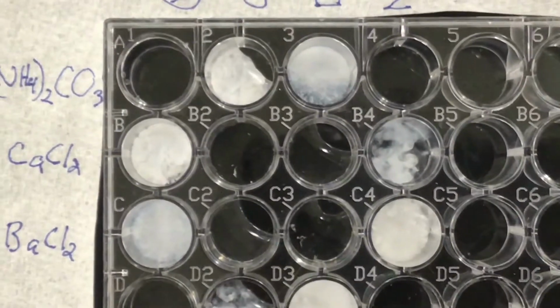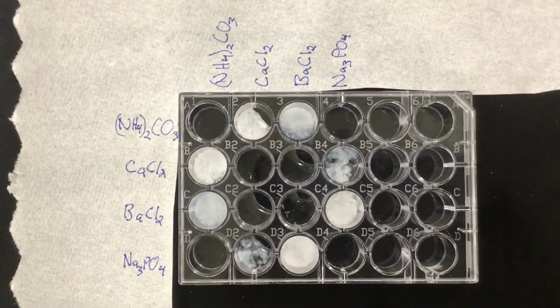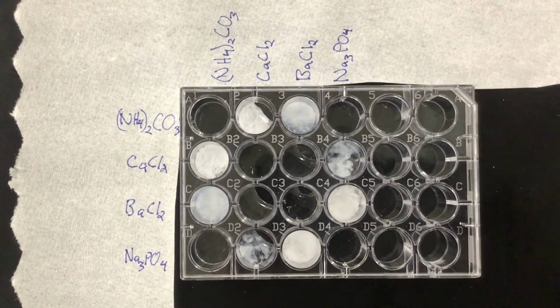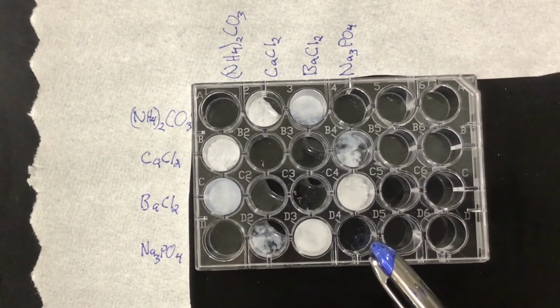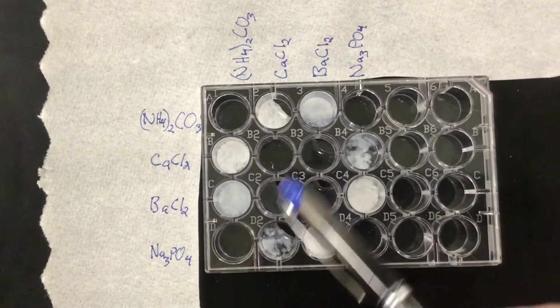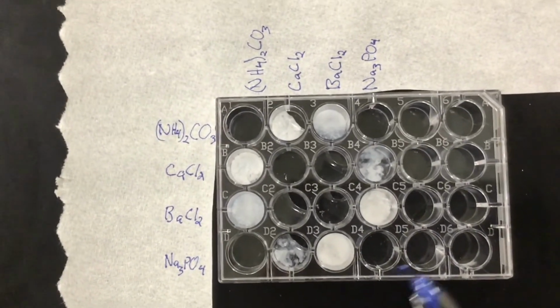And here is the end result of that lab, where you can see kind of the times table of which ones would react. It should make sense that we have no reaction all the way across, because that's where they're mixing with each other, and that a couple of them should mirror each other, as we see, because they're mixing with the same thing.